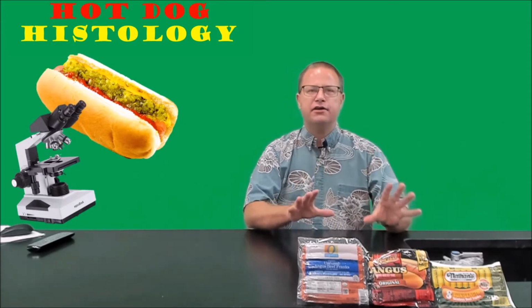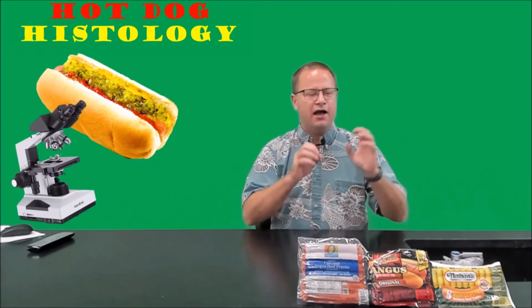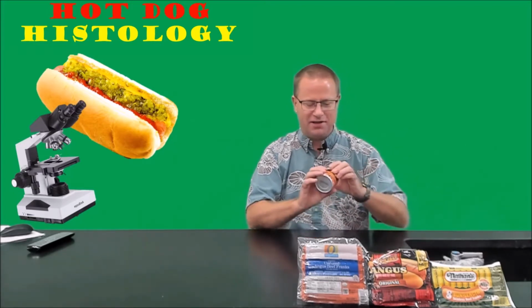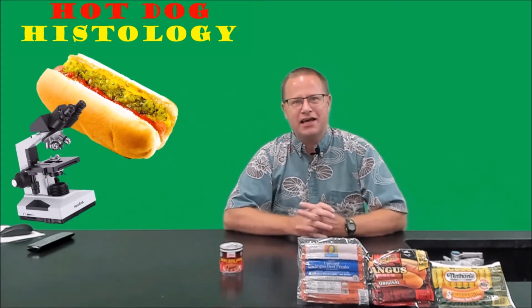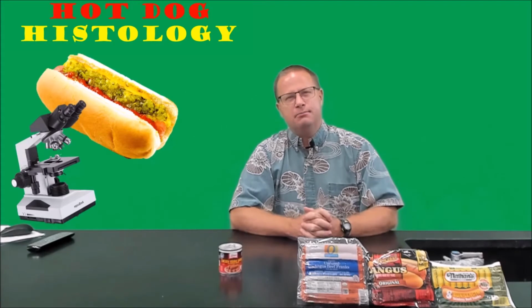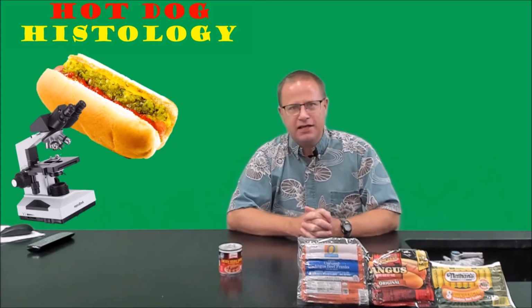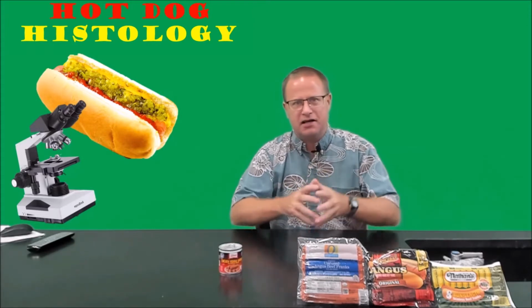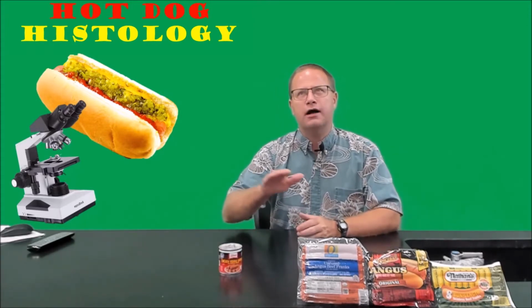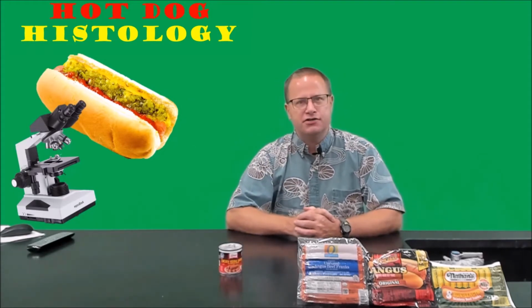So all of these hot dogs are pretty high-end, and we'd expect them to have a high proportion of muscle tissue that is skeletal muscle. Now, as a ringer, I'm going to throw in an outside one, and these are Vienna sausages. Vienna sausages, if you haven't had them, are probably the most processed meat product on the planet. If you look at a Vienna sausage, it's not really recognizable muscle fibers or anything like that. And so we're expecting them to have fewer recognizable muscle fibers and maybe a higher proportion of adipose tissue.